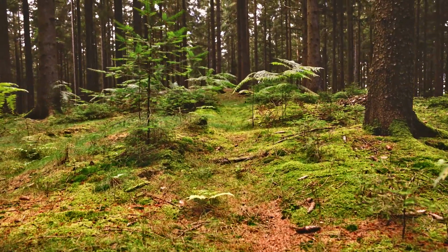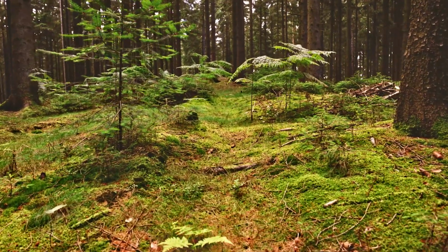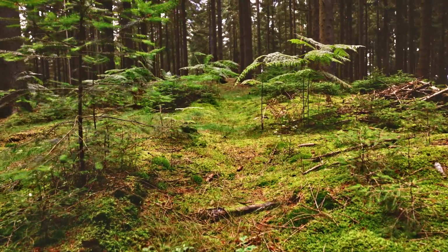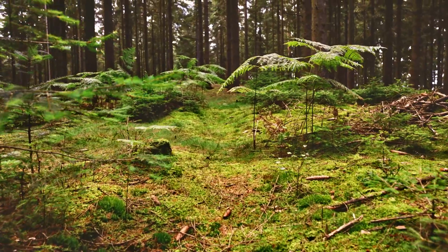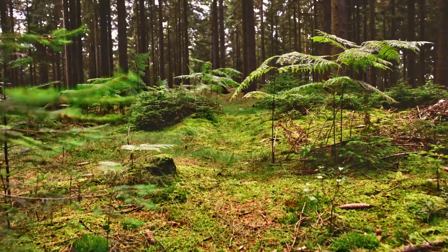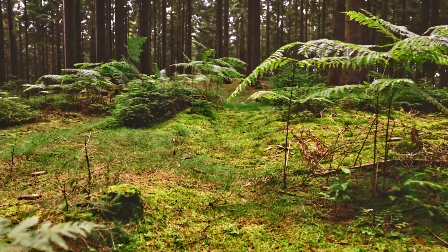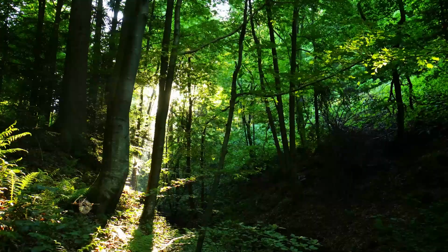Today we have another episode from our Cos-Moss series. In the first episode, we looked at street moss under the microscope, which is typically found in the cracks and joints of roads and sidewalks. If you missed the first episode and are interested in what we discovered in the street moss, you can find a link to the first episode in the video description.